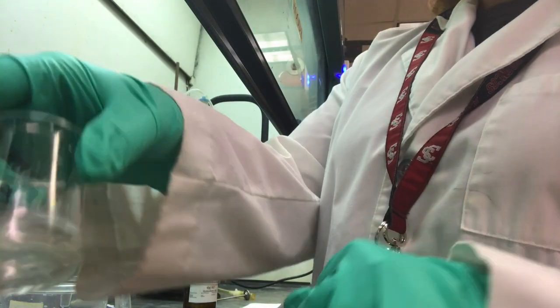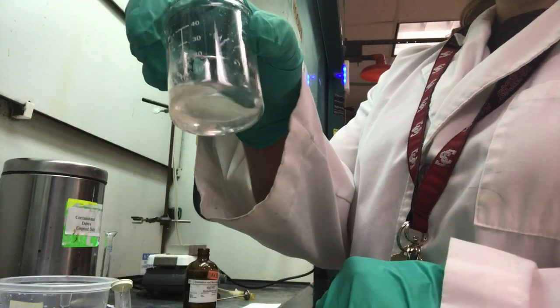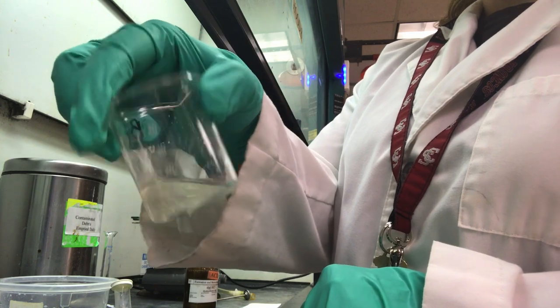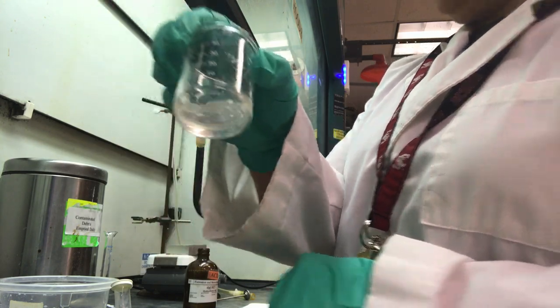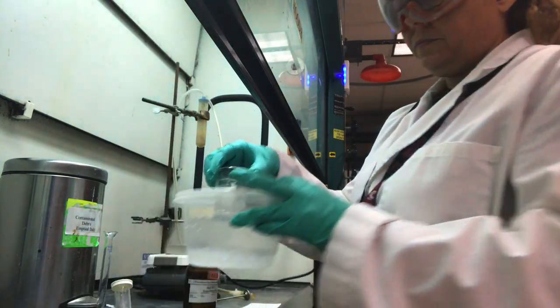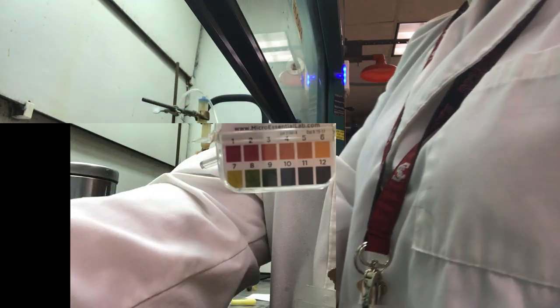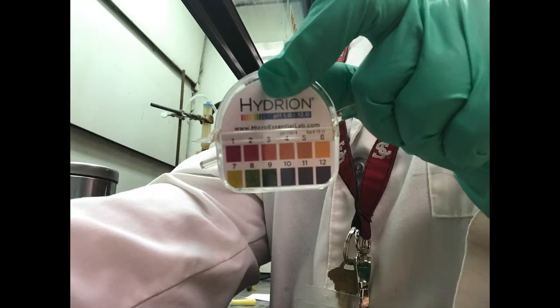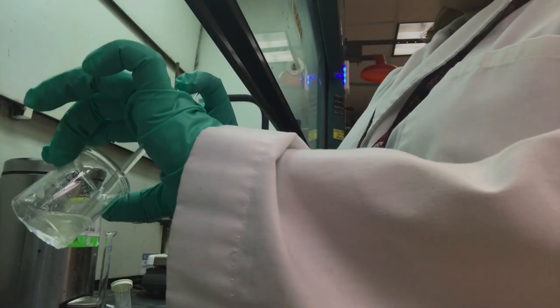It's time to isolate the carboxylic acid. Carefully add 6 molar hydrochloric acid to the aqueous solution while cooling the solution in an ice bath. Continue small additions of HCl until a pH of approximately 1 is reached using pH paper.